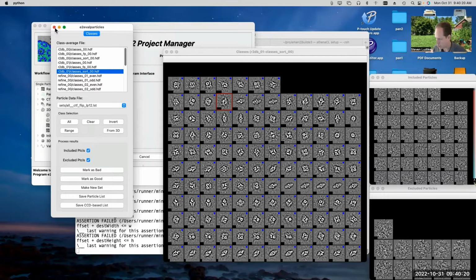So I'm not actually going to do that right now because I've already run refinements and that sort of thing. I'm just explaining the logic of this program to you. This program can be used for a bunch of other things as well. The idea is that it'll do various operations based on class averages. Any questions about that before I move on? Okay.